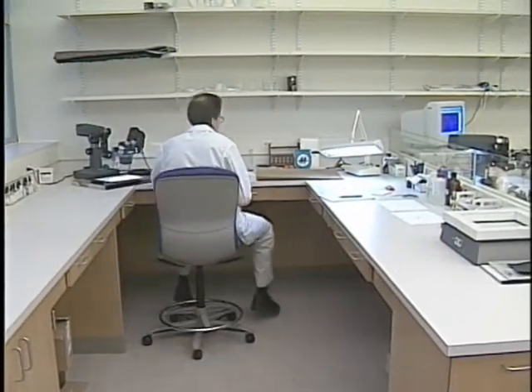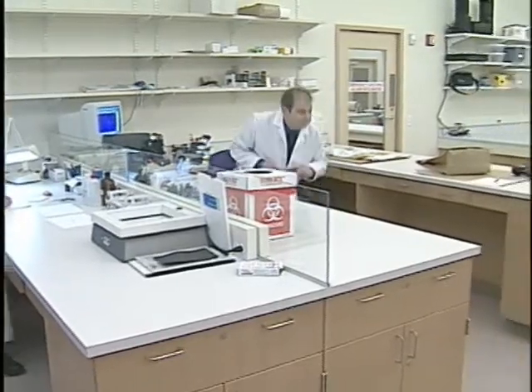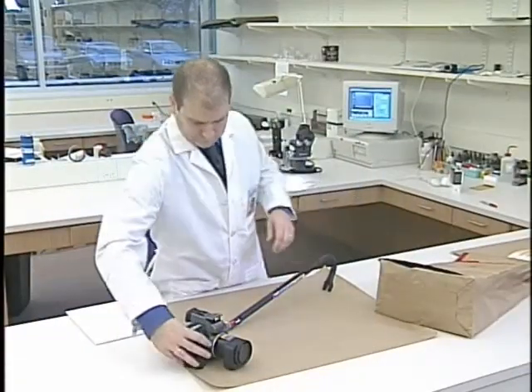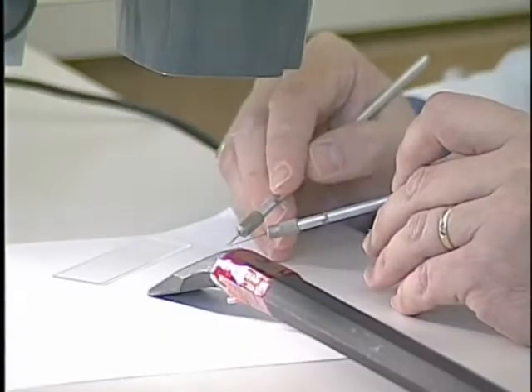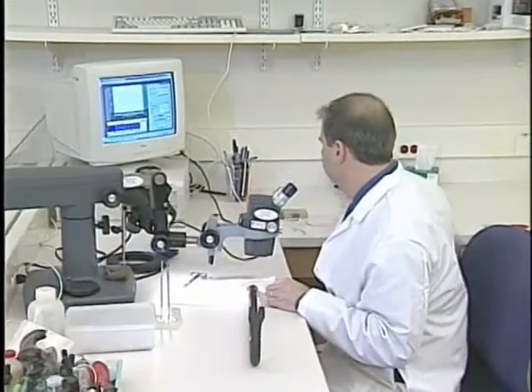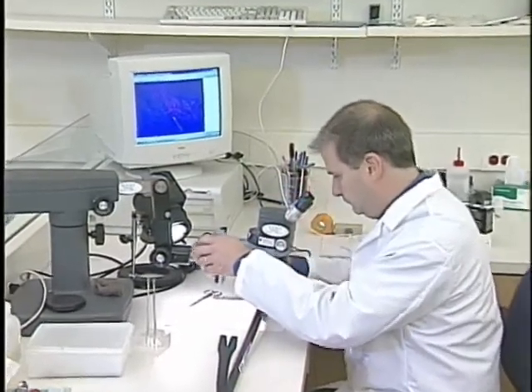The microchemistry unit uses particles coming from or impressions made by manufactured items to associate the item with a crime scene or criminal suspect. Almost any manufactured item can be a candidate. Care and diligence in gathering evidence is very important. Employing a stereomicroscope and using instruments as delicate as dental tools, items are examined to discover any trace evidence. After evidence specimens are removed and prepared, the process of analysis and identification begins using one of several procedures and instruments.